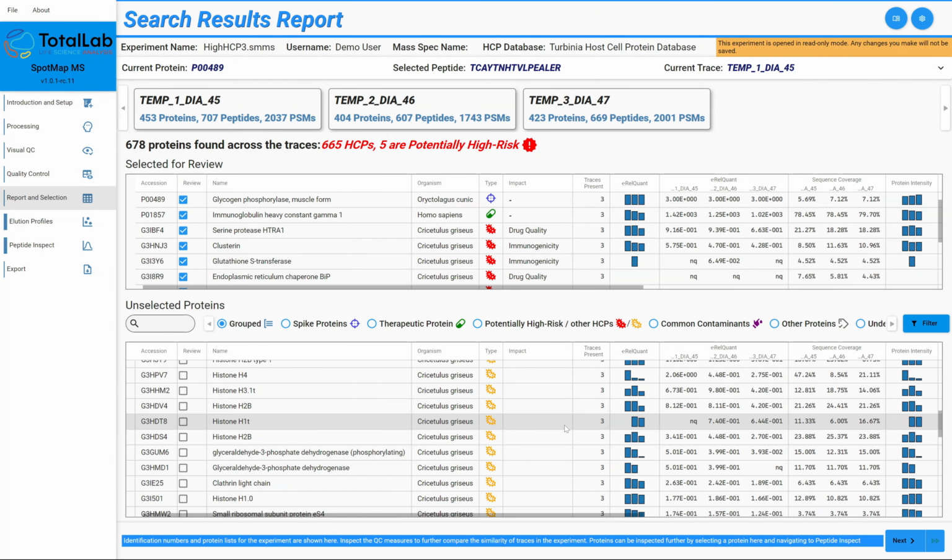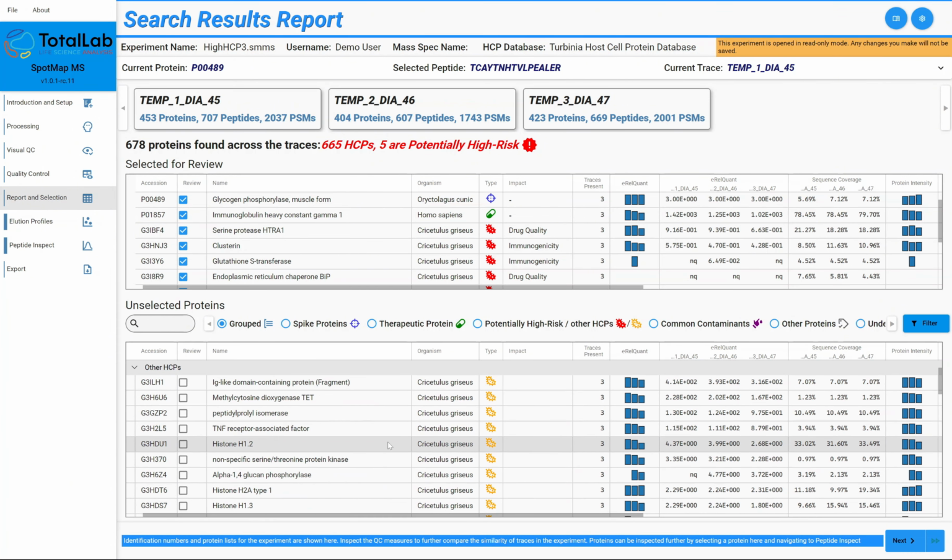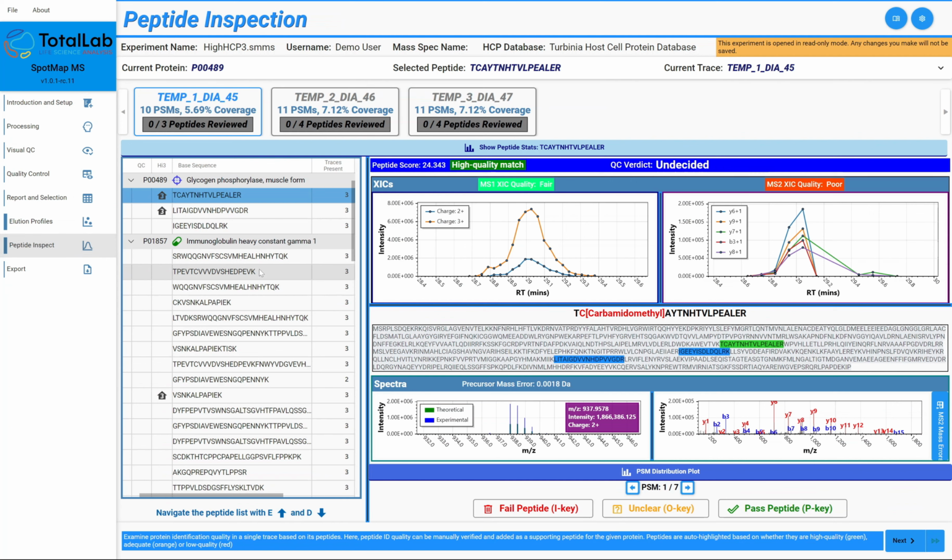Once you've selected the proteins that you want to add to your hit list, your high risk list, or the ones that you're particularly interested in validating, then of course we can come down to our peptide inspect window and look at the different matches, the quality of them, etc. I've got another video on this which goes deeper, so I'm not going to rehash it here, but please feel free to check out the playlist full of SpotMap MS tutorials if you're interested in learning more about basically every different mode of your analysis within the software.